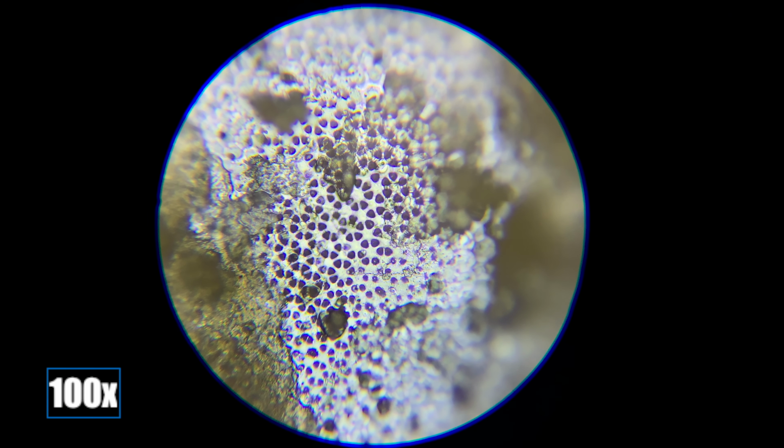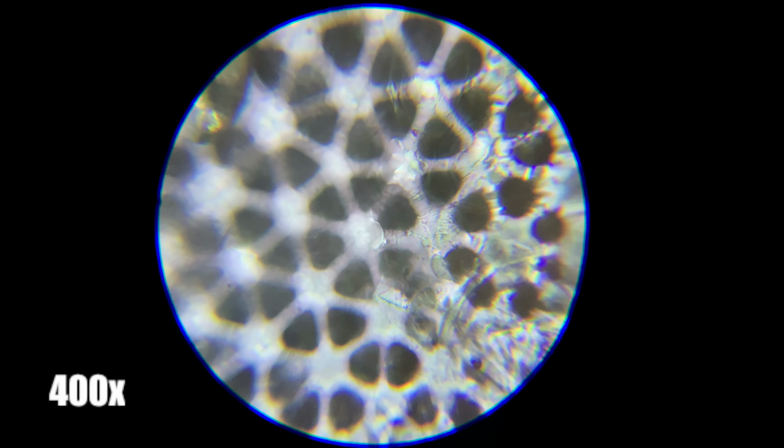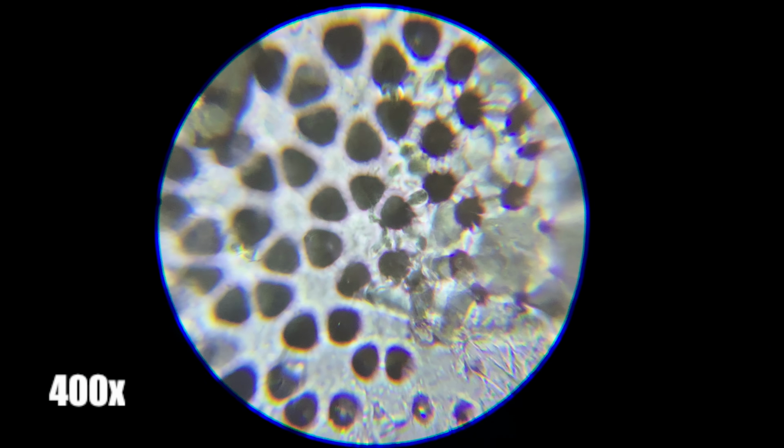These structures are shown here at 100 times magnification and are comprised of 6 to 8 protein groupings making up these pores. It's tiny, intricate structures like this that make me enjoy microscopy more and more, being able to look down the microscope and see a hidden world waiting to be discovered.